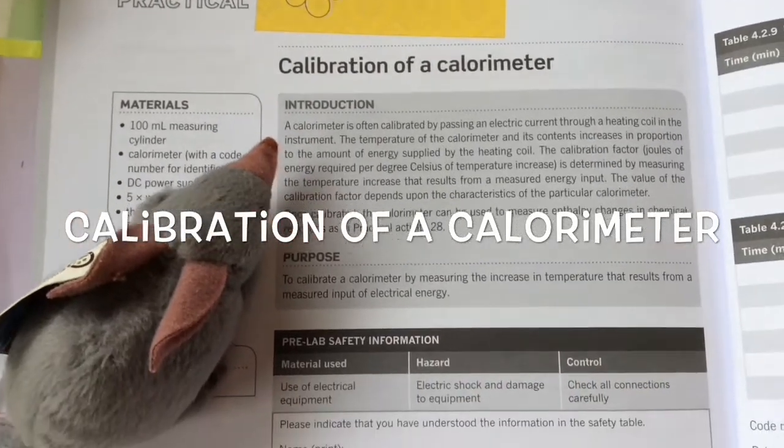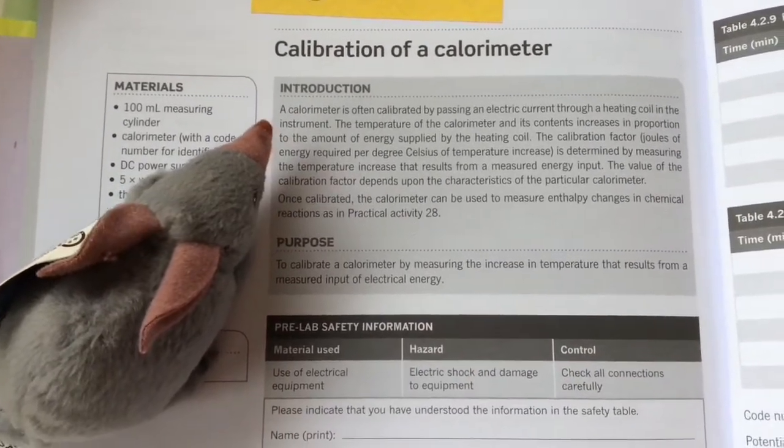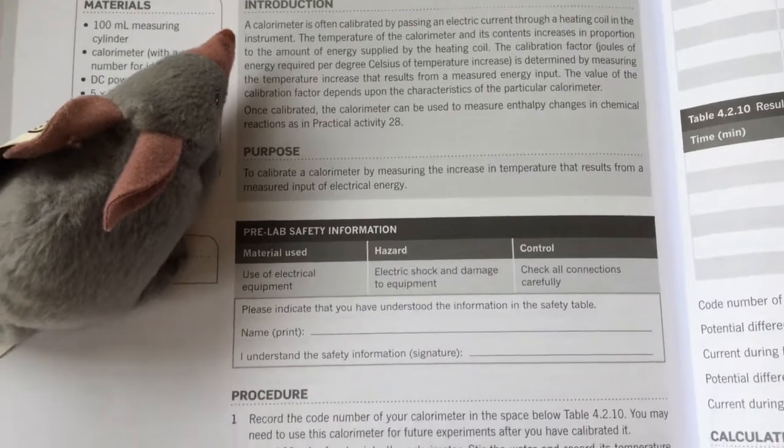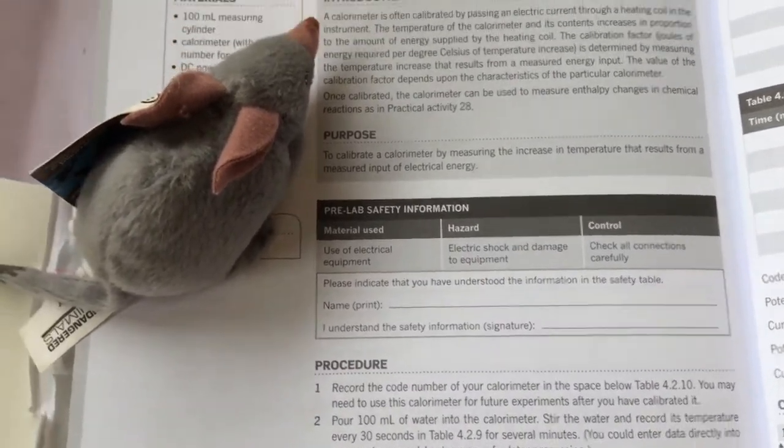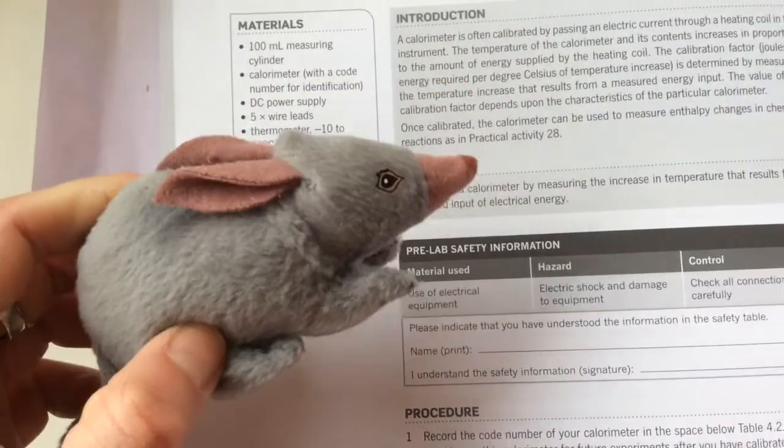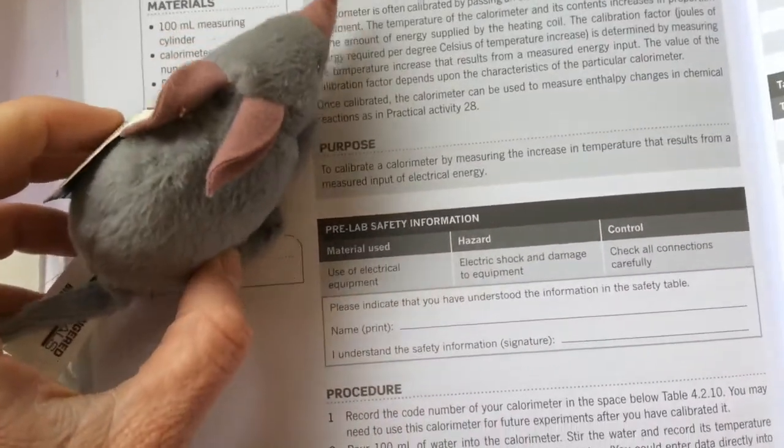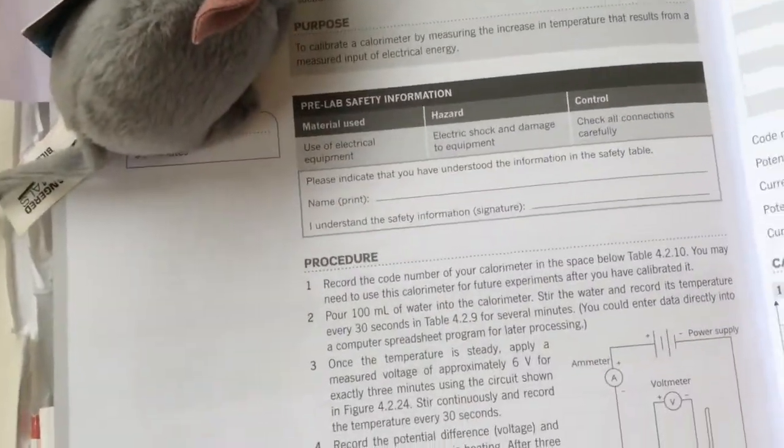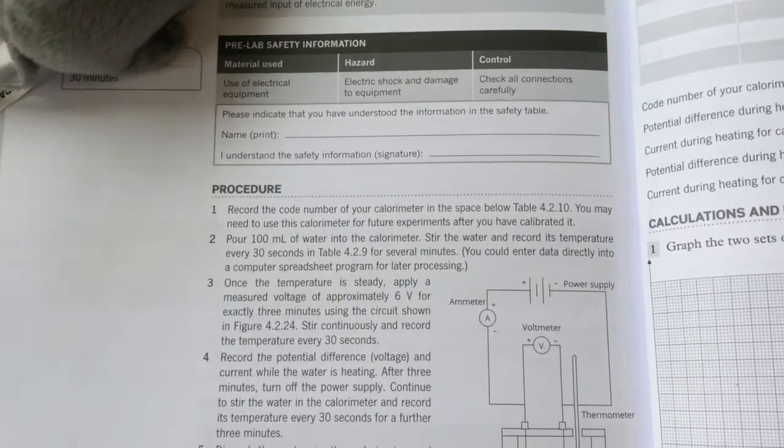The first part is calibration of a calorimeter. So make sure you read through the intro. And I've got a little assistant here. This is Billy, the Bilby, going to help me out. So basically, I've got to pick a calorimeter.